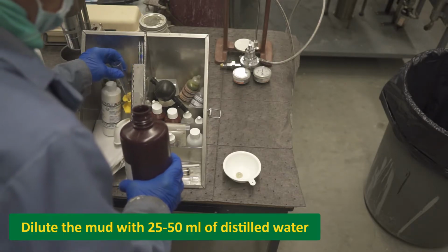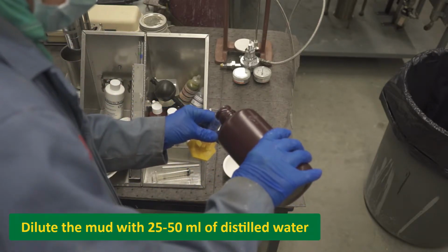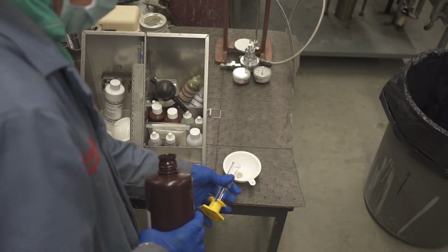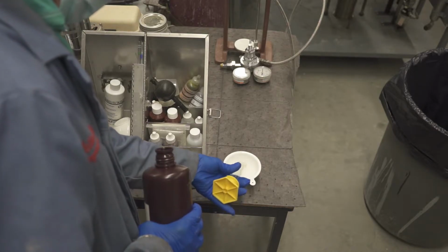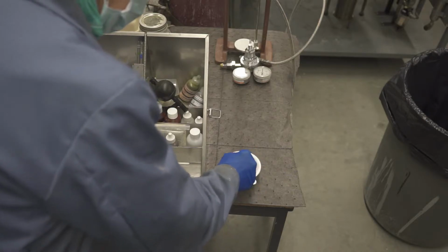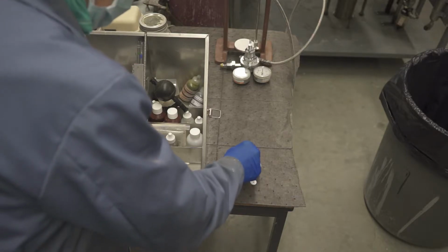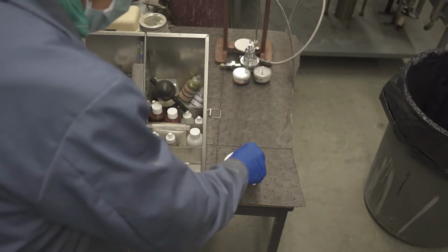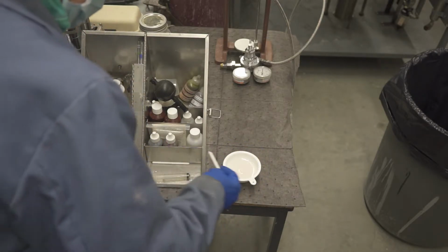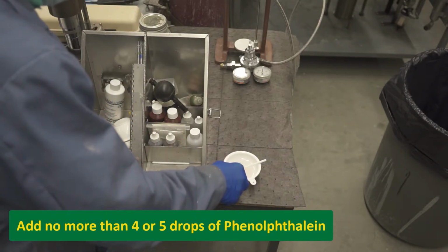Now dilute the mud with 25 to 50 milliliters of distilled water and add no more than 4 or 5 drops of phenolphthalein.